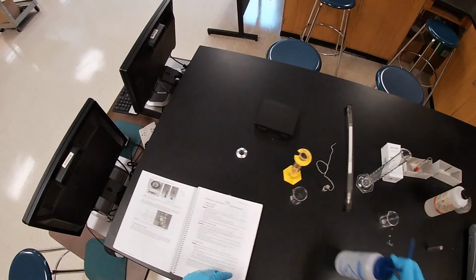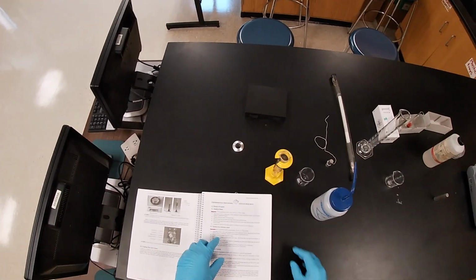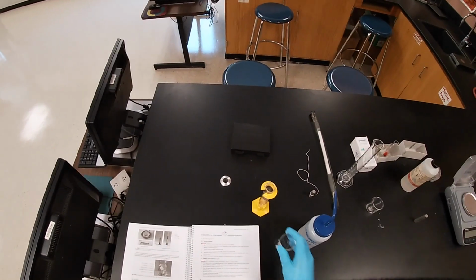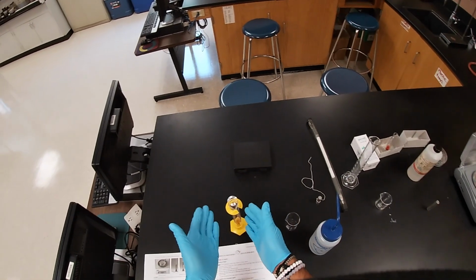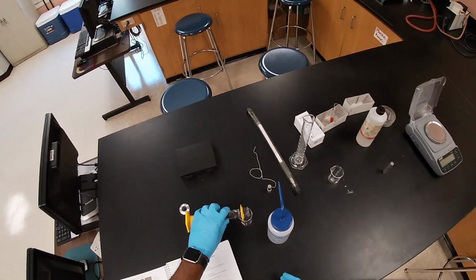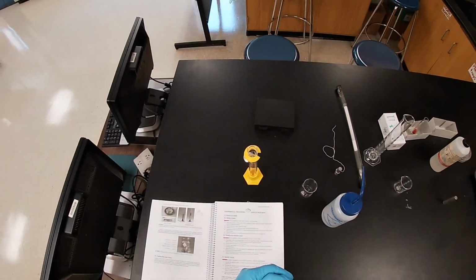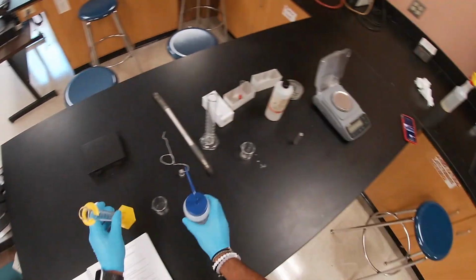Okay, so first they ask us to measure out about 20 milliliters of water. Once we measure out the 20 milliliters of water, we've got to get the mass of the beaker by itself, and it's dry. Once we get the mass and we have the volume already recorded, we're going to place the water from the graduated cylinder into the beaker, and then get the mass again. What we're really after is the mass of the water by itself. And then we're going to calculate the density. Okay, so let's go ahead and do that first.